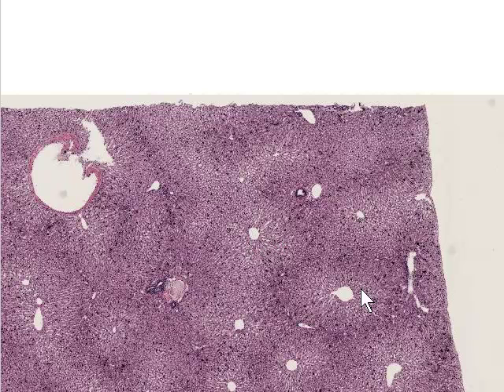venules. And you'll see that in general the radiating plates of hepatocytes closest to the central venules tend to stain a more pale color, and this is because they have less organelles and store less glycogen in particular than do those cells closer to the portal canals. We can see structures like this, which are very large feeder branches, which will give rise to the smaller vessels at the portal canals, and then some very large vessels like this is probably a hepatic vein.